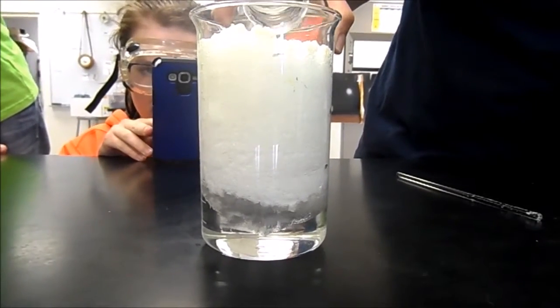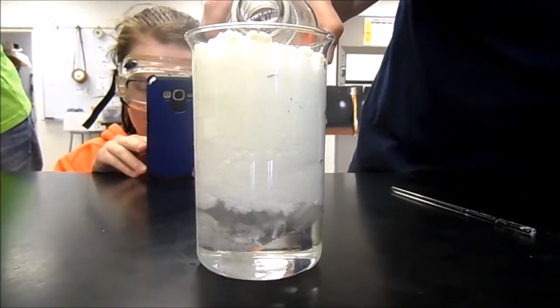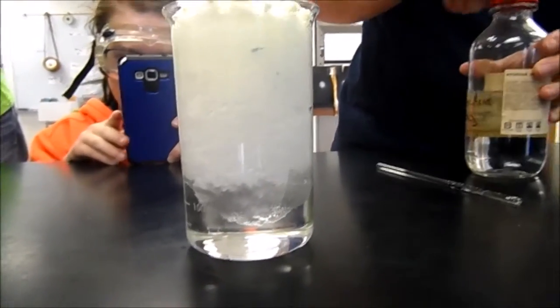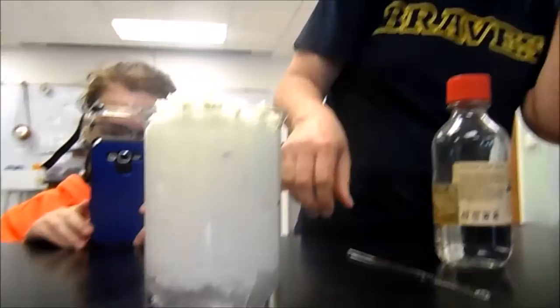And actually what we'll do is take some of that stuff off the top. Will it burn you if you touch it? The stuff on the top, probably not unless there's some acid on it, but don't touch it anyway.